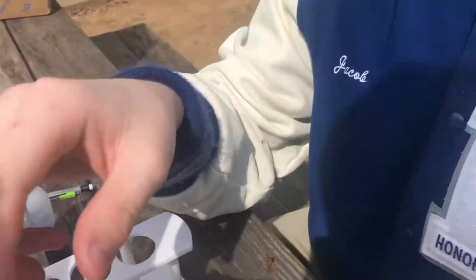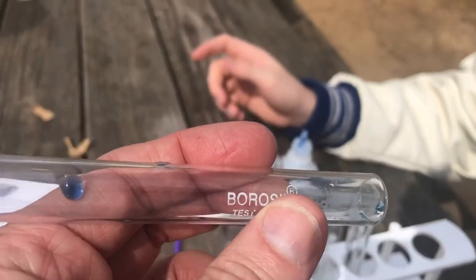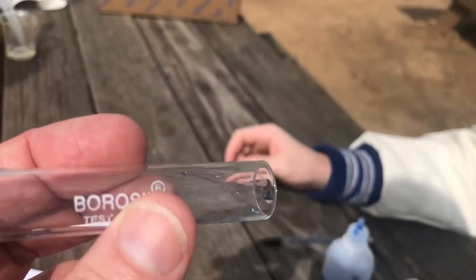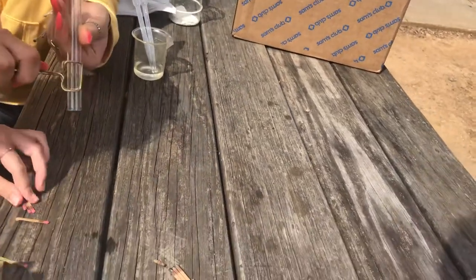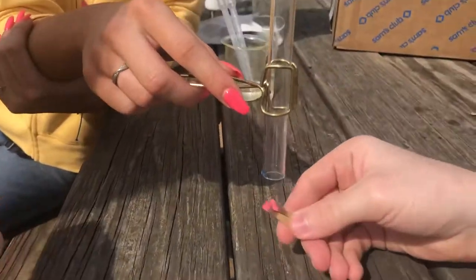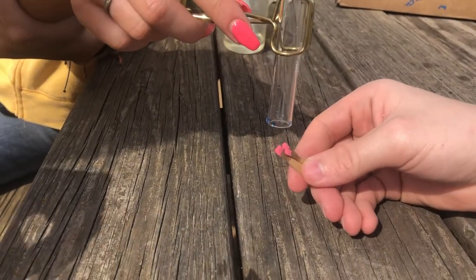We're going to add pollution, which is going to be more likely to get in near the open mouth of the test tube, so you're more likely to see the change at this end, not the top end, because the pollution may not make it all the way there. We're going to add some pollution with some matches. The end of those matches — what helps them strike — is just sulfur.